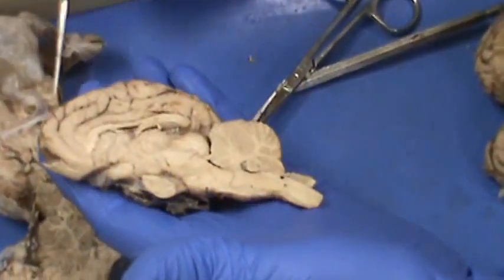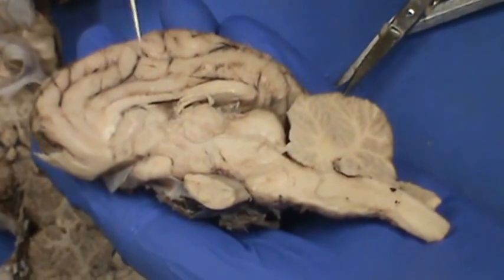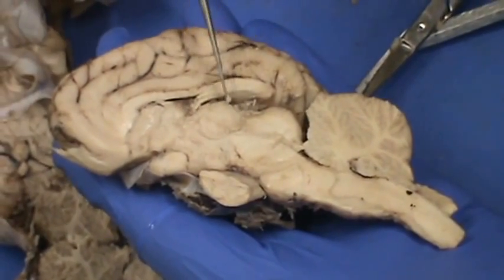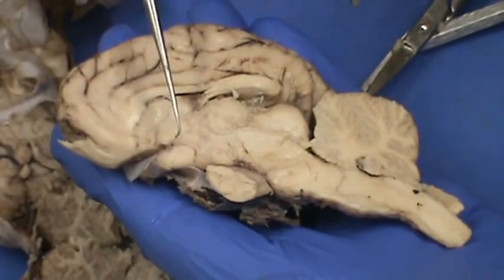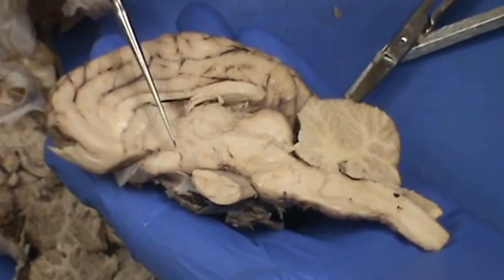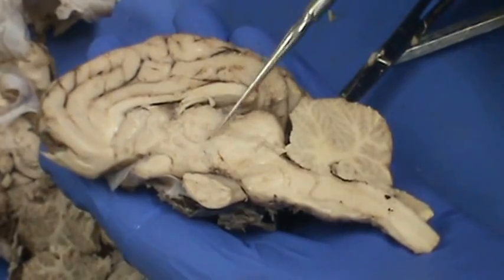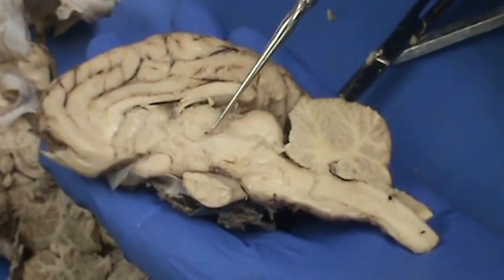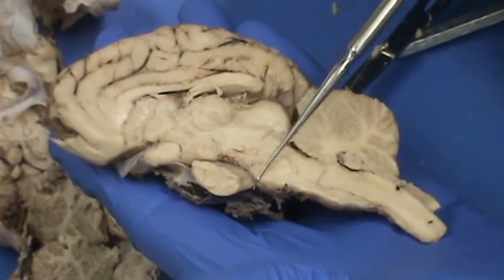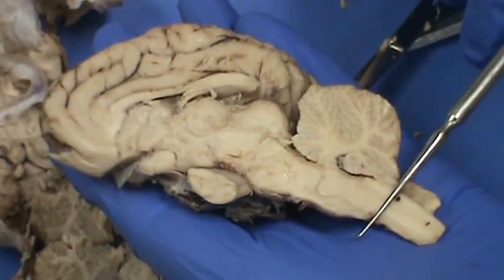Opening up the brain, this white C-shaped structure here is the corpus callosum. This round structure here is the thalamus. This right here is the optic chiasma, and the area between the optic chiasma and the thalamus is the hypothalamus. This is the pituitary gland again. From the thalamus you can go out to the brainstem: from the thalamus you have the midbrain, then the pons — the wider area — and this is the medulla. The foramen magnum would sit about right here.